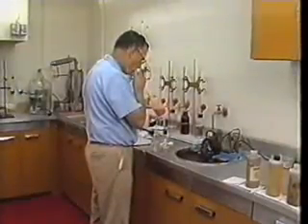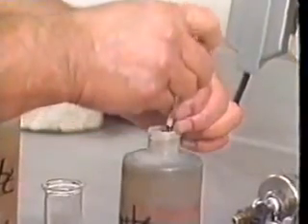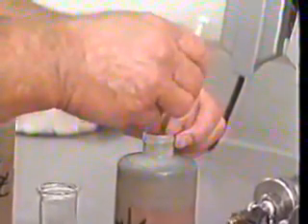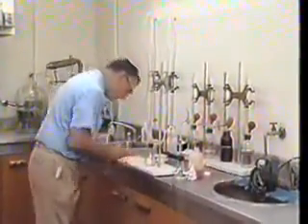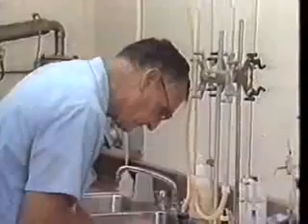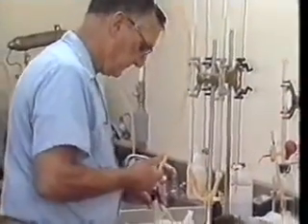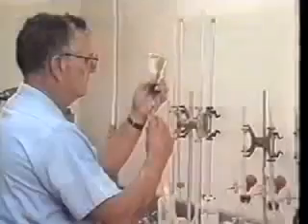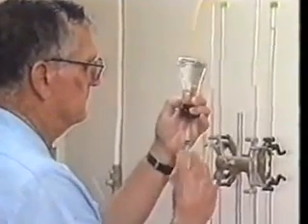Once a sample has been taken in the field, it is delivered to the laboratory for testing. Here, lab technicians pull a portion of the sample to measure the percentages of each hydrocarbon in the gas stream. They check for percentages of H2S, CO2, and water in the various samples. Gas is also evaluated for its BTU, or British Thermal Unit value. All of this information is processed, and decisions regarding sales contracts, reservoir studies, property evaluations, enhanced recovery programs, and engineering for new facilities are made.